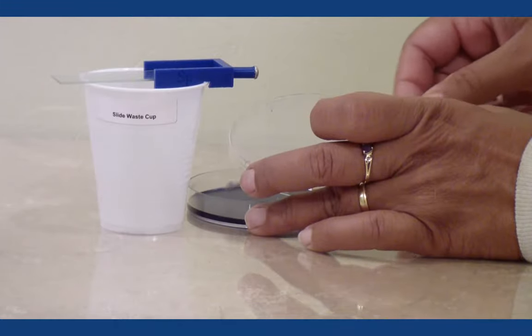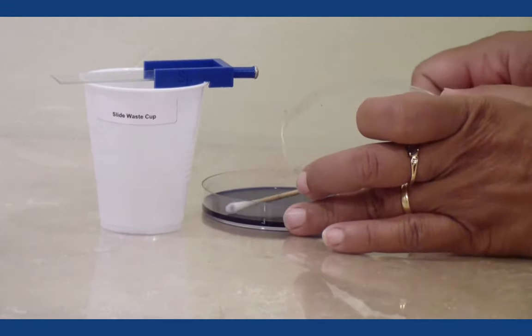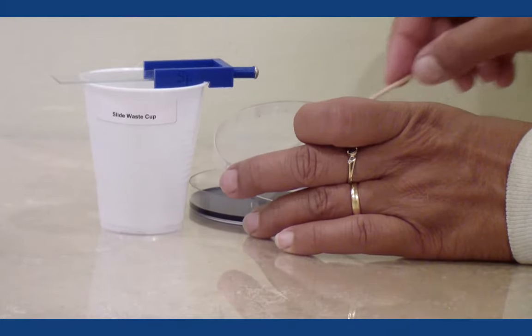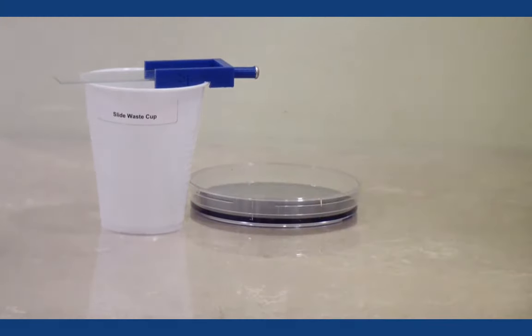Incubate your plate for two to three days as you usually do, noting the temperature every day. While you did that, your slide would probably have already dried because the amount of moisture from your saliva is not much.